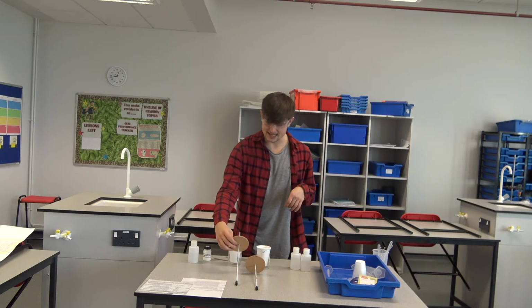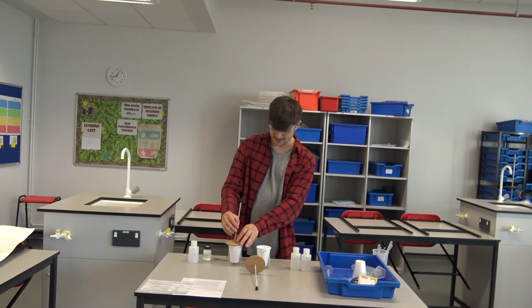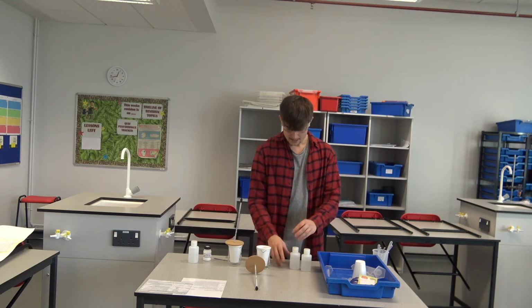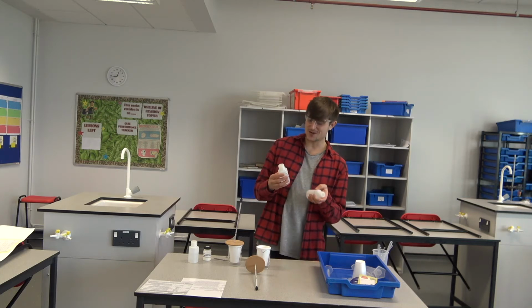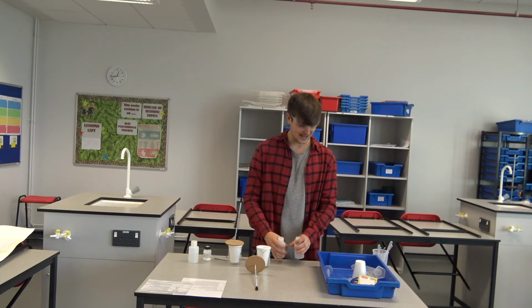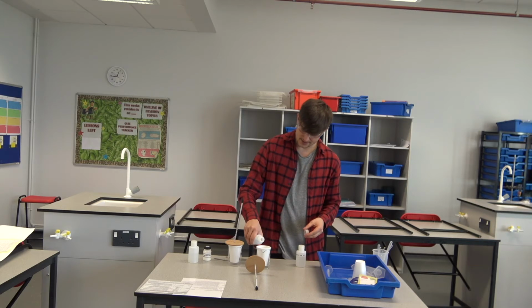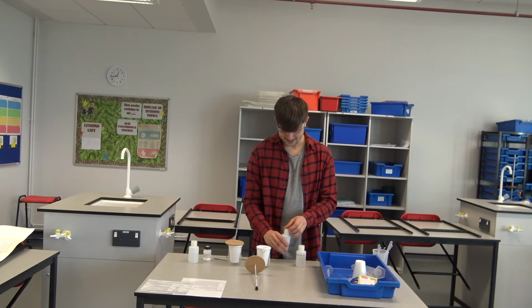And it's key to take a starting temperature. So let's pop our thermometer in and take a starting temperature. It's around room temperature at 21 degrees C. The next one, we are going to do a neutralization reaction. You might already know whether neutralization is exothermic or endothermic, but let's just see. So I'm going to put some sodium hydroxide in, and I'm going to put some hydrochloric acid in. Remember to take the starting temperature as well of that.